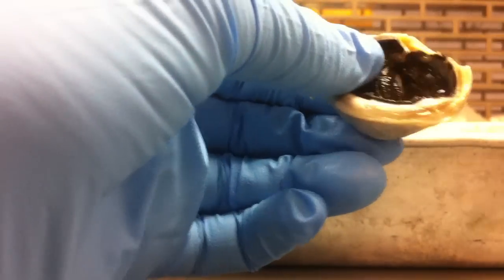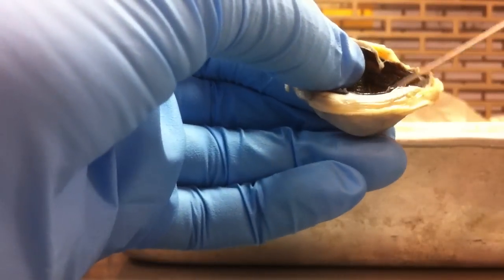We're going to take the lens out for this. And your pupil is that space right here.